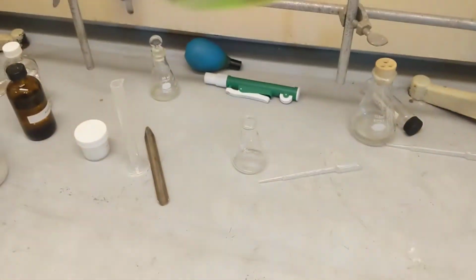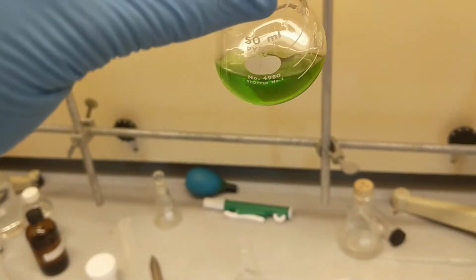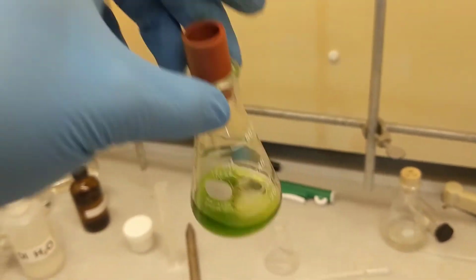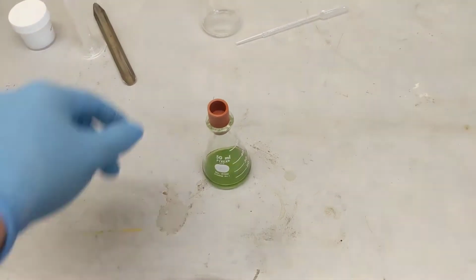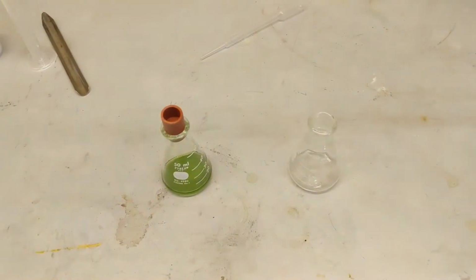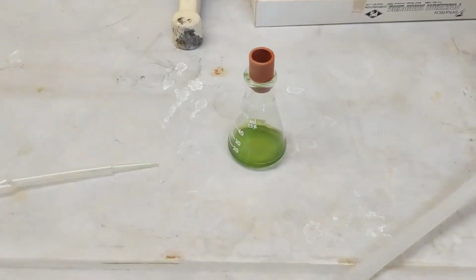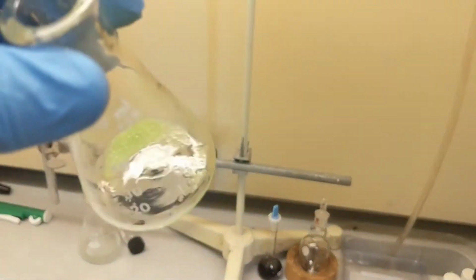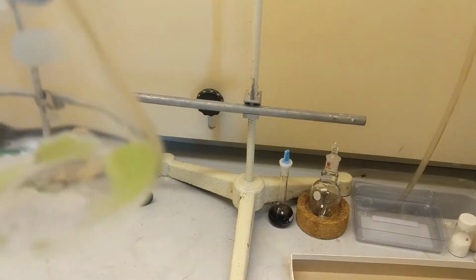I have my drying agent in there, my anhydrous sodium sulfate. As you can see, it moves freely, no clumping, it's nice and dry. Did a good job on my separatory funnel work. Now, just gonna transfer it into a clean Erlenmeyer with a Pasteur pipette and evaporate off my hexane. Here we go. This is the drying agent. As you can see, there's probably some more in there that I could try to get out.